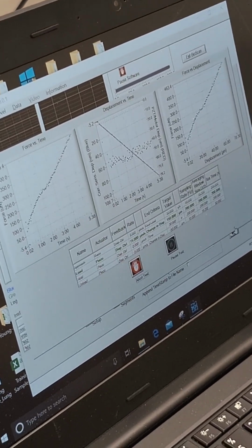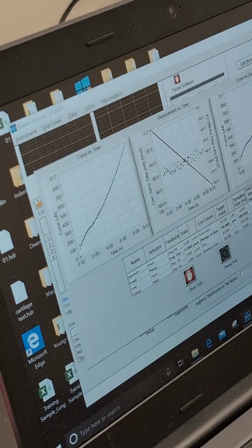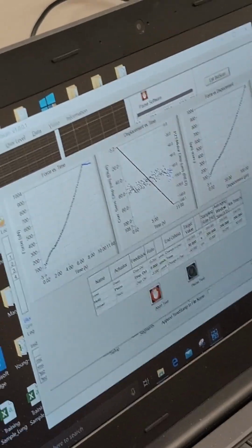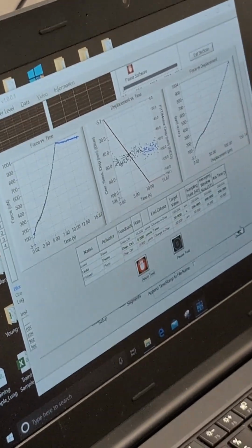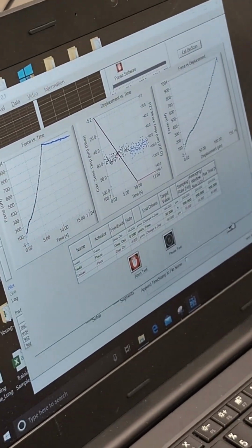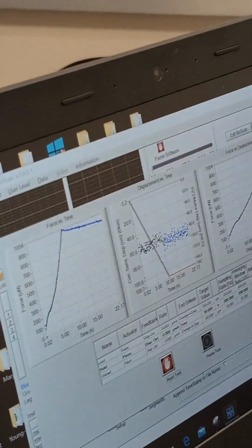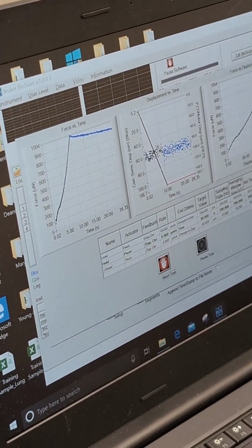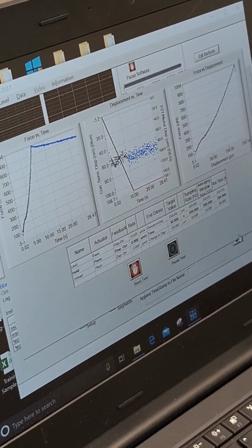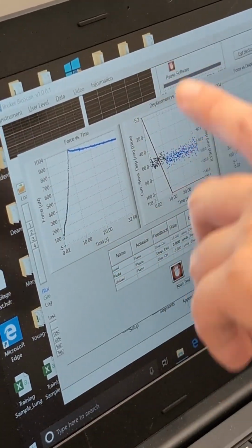So you see, if you find the force correctly, it's actually able to absorb as much force as possible. Previously, the first test was roughly around 1,100 something, and then the second test is much lower because there's too many empty spaces in between. When you find this constant of starting force, you eventually get a more consistent, what we call the transient force.